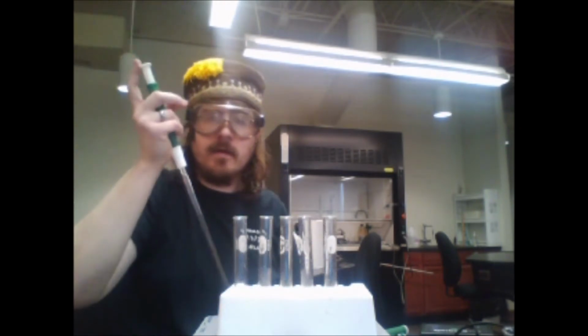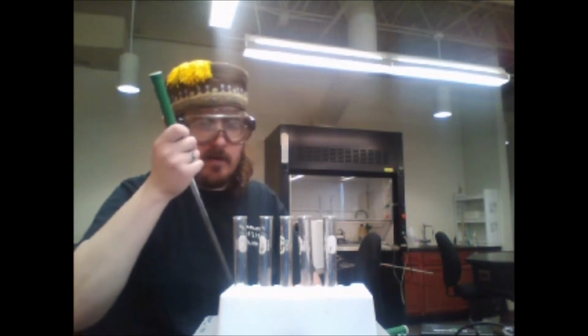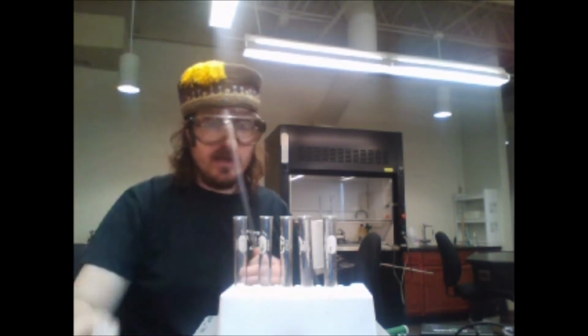Our last 5. With that, we put this away for now. We are done with the concentrated KSCN.